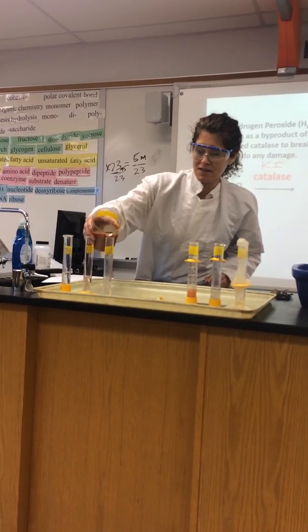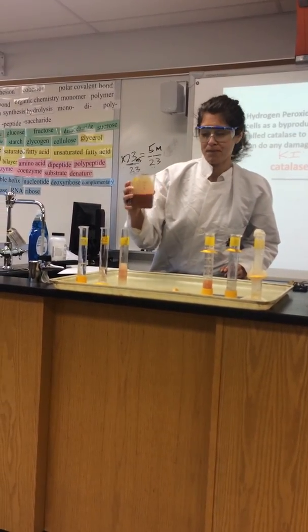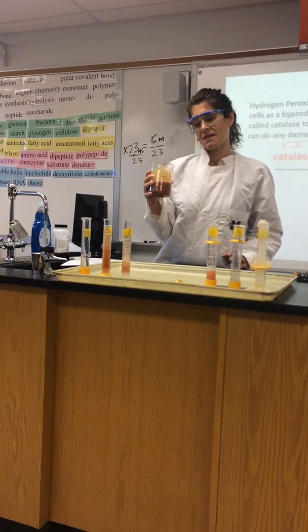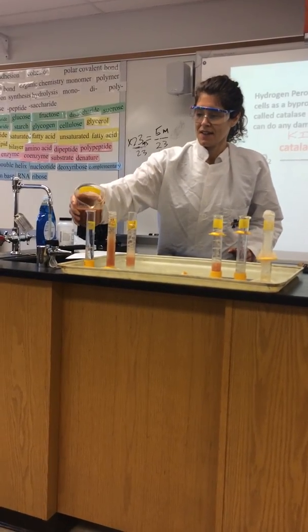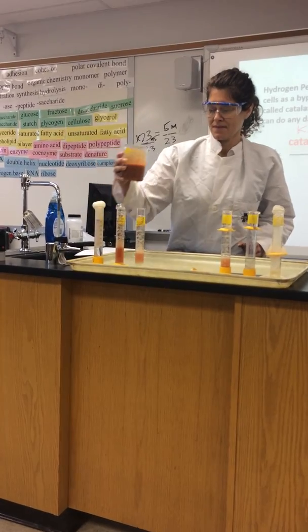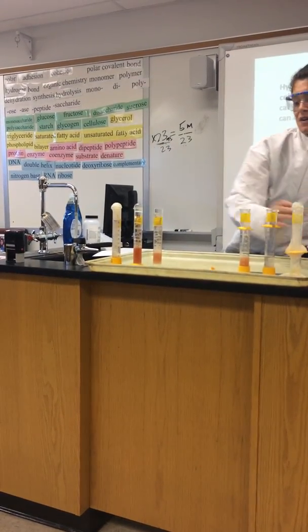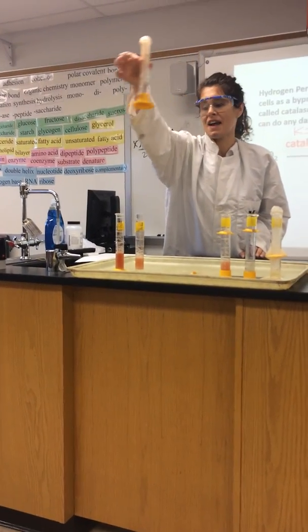So we have D, then we have E which is a base, and then we have the neutral. Notice which one completely overflowed — look how much bubbling you got in F, the neutral.